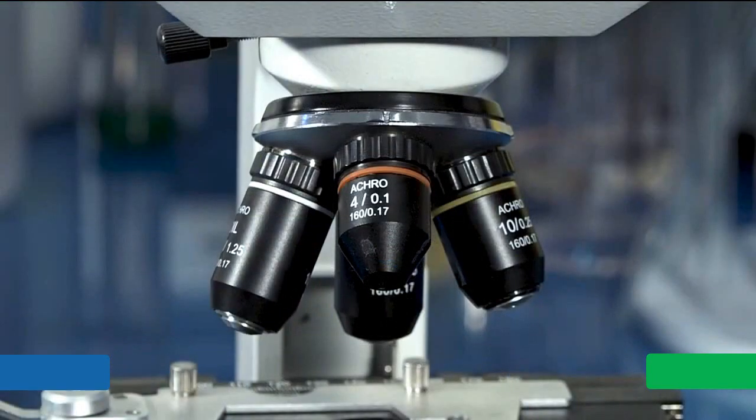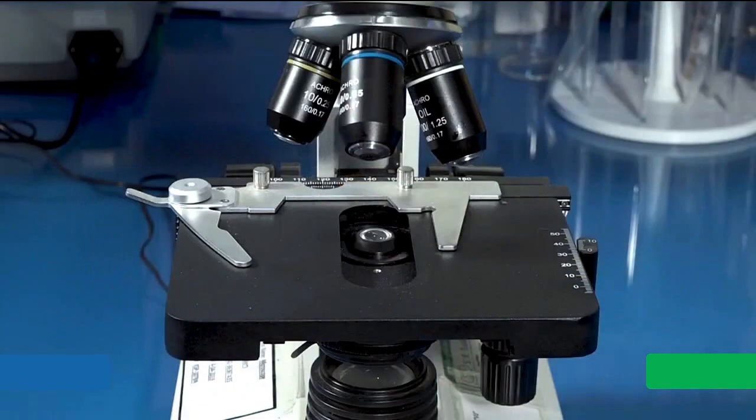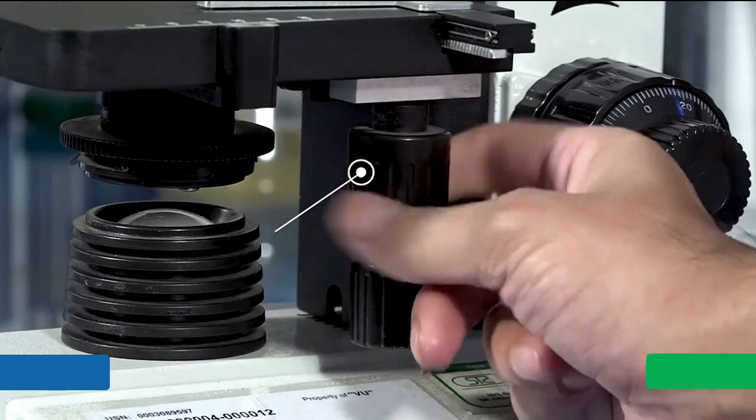A compound microscope usually has 4 objective lenses, which are of magnification 4x, 10x, 40x and 100x. Once the slide is placed on the stage clip on the stage, it can be adjusted using stage controls.